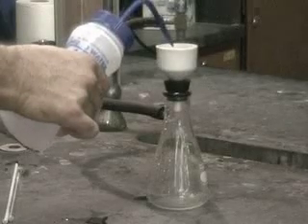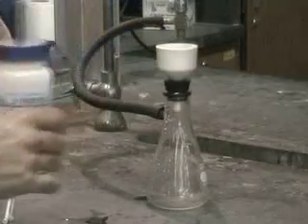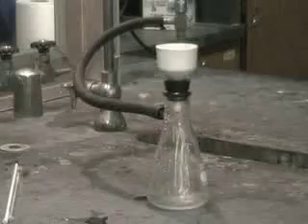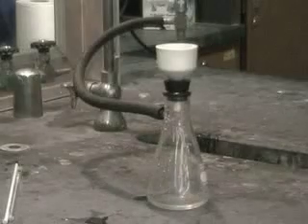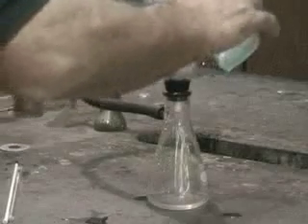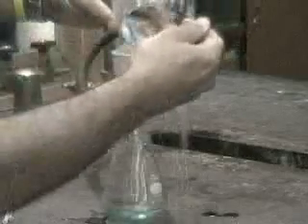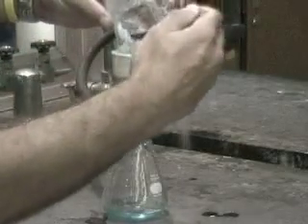We filter out the solid precipitate using the Buchner funnel. We chill the Buchner funnel so that the potassium nitrate doesn't warm up enough to become more soluble in the water as it passes through the funnel. We again decant the liquid first and then add the solid to the Buchner funnel to dry.